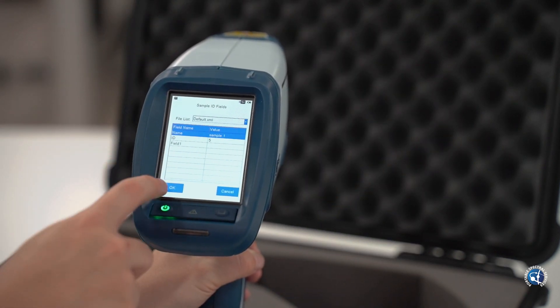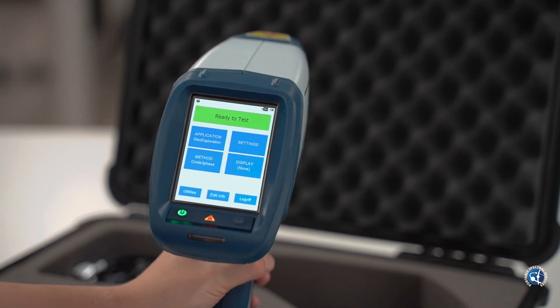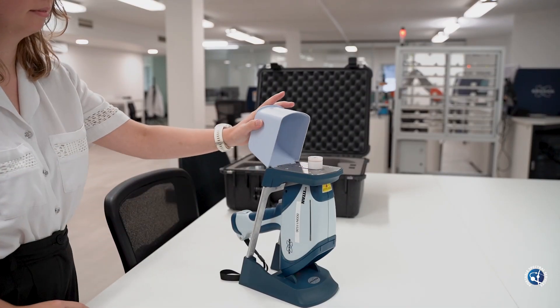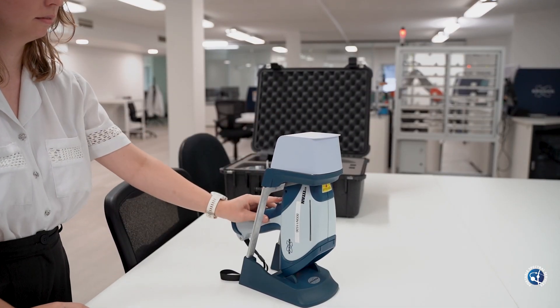When you're done, press OK. Now you're ready for analysis. Place the examination window against the sample and pull and release the trigger.